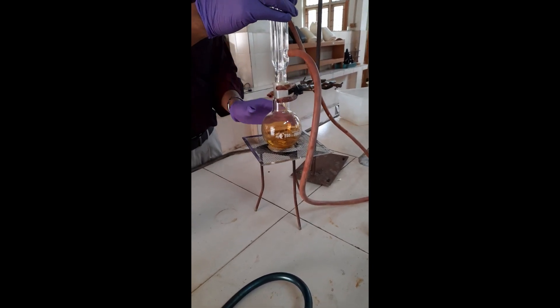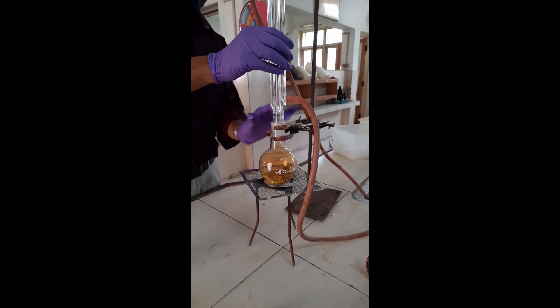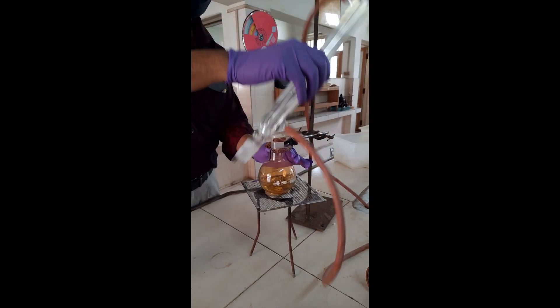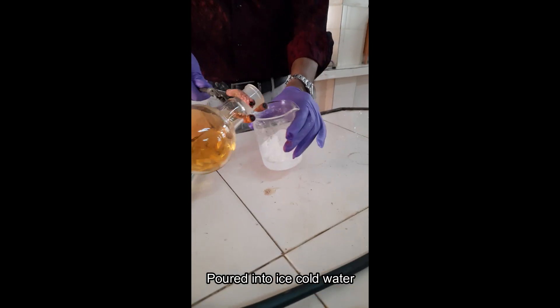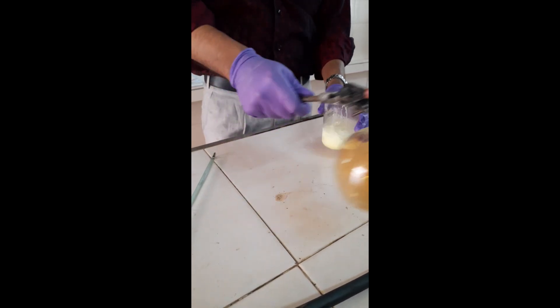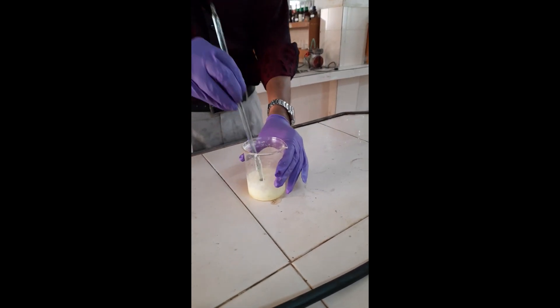Allow the contents of the RBF to pour into ice cold water, and let it stir for a few minutes.